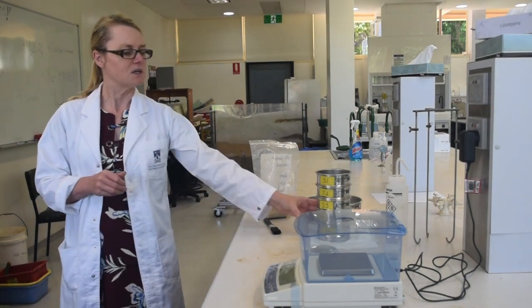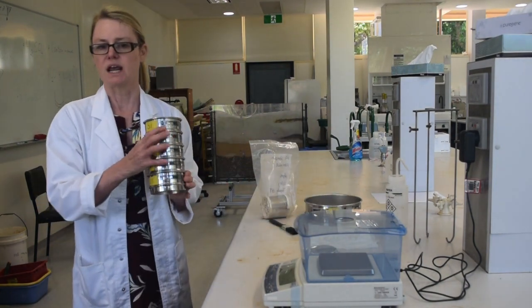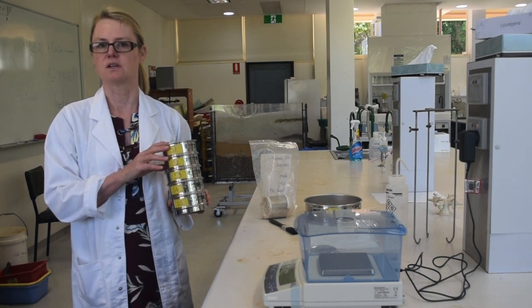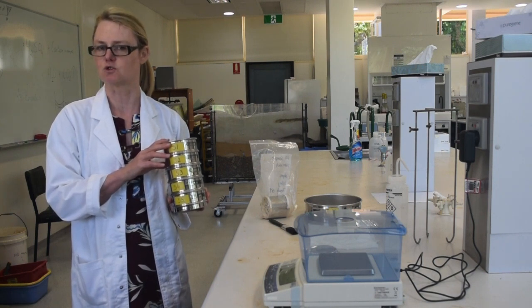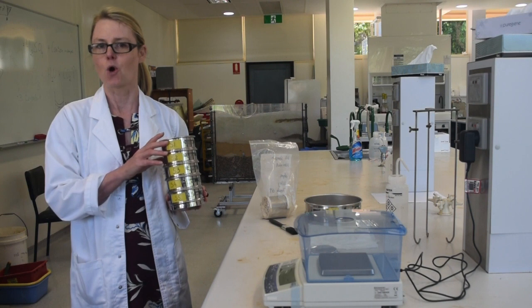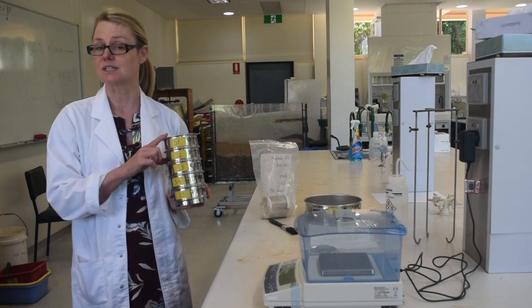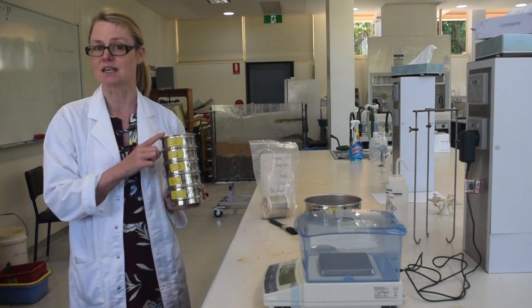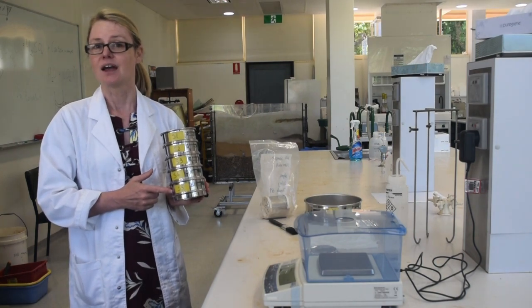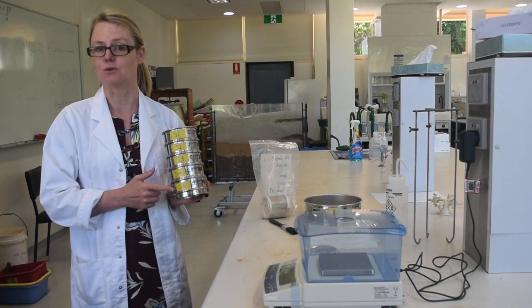You're also going to be using this set or nest of small sieves to help you determine the distribution of your aggregates. An important thing to do before you start using these is to check that they're in the correct order. The correct order is also listed in your lab manual.